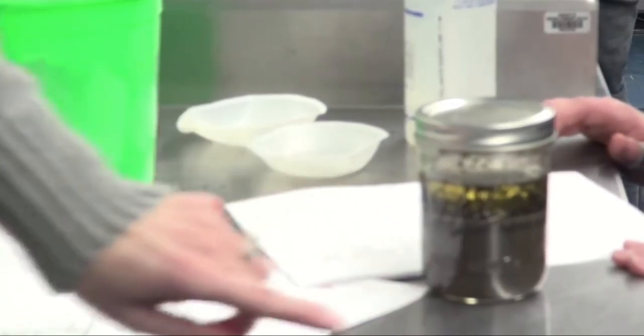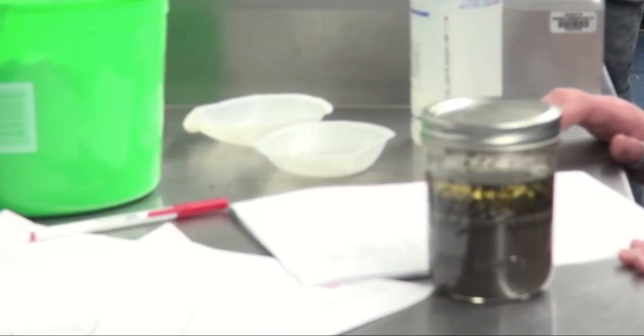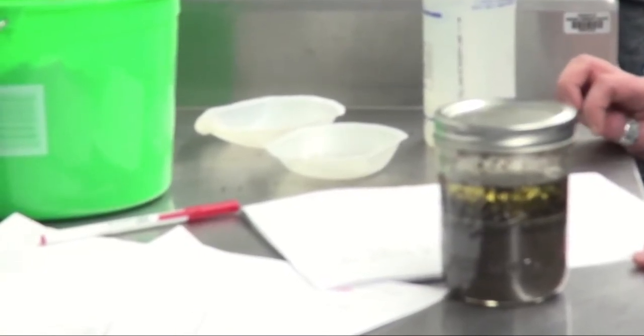And then to finish up this lab, what Gracie's going to do is take a ruler. She's going to set it alongside here, and she's going to measure those 3 layers. So she's going to measure the total of the 3 layers, and then she's going to measure each individual layer. And from that, she'll take those percentages that she figures, and she'll come to our soil texture triangle. You want to talk about that a little bit?